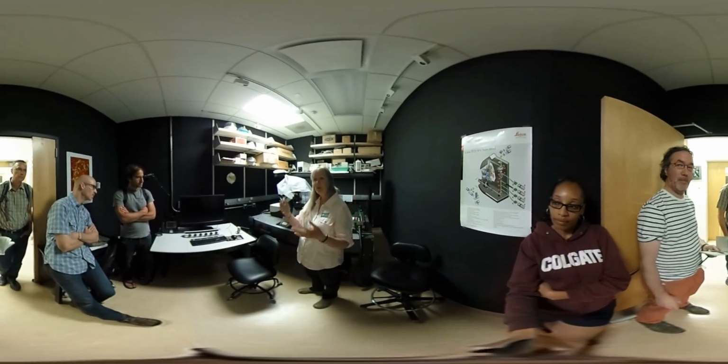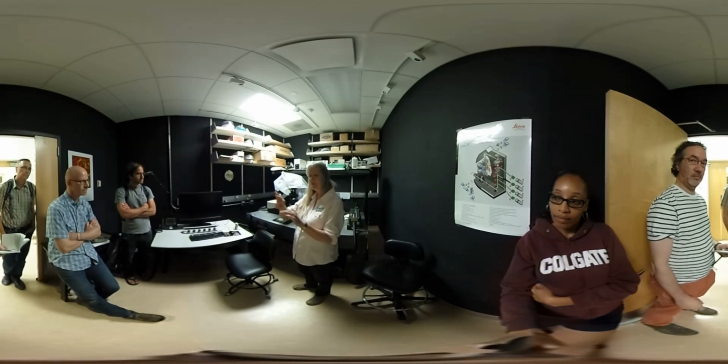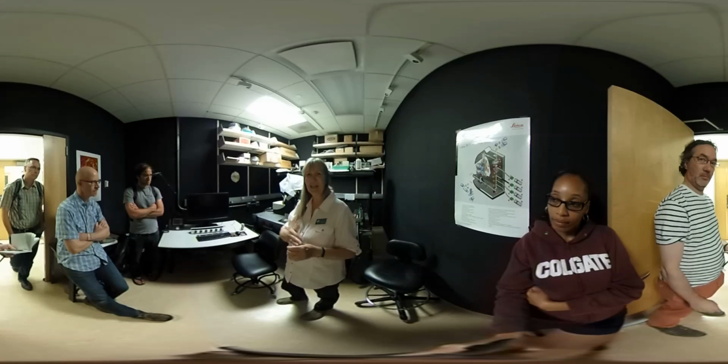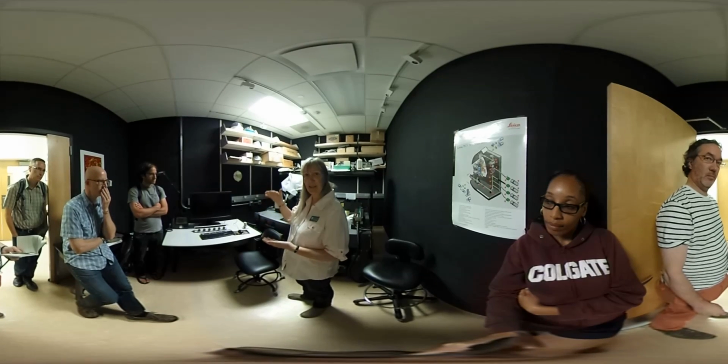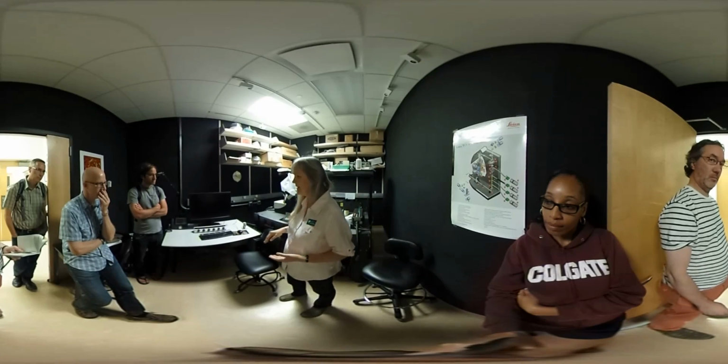Yeah. So to make a 3D image on this machine, if you think of a banana, you can cut a banana into lots and lots of slices. And so what this does is it optically dissects material. It makes optical sections. So think of a banana, each of those slices would be a section. So you're focusing up and down on the material that's on the stage and you're making these optical sections.